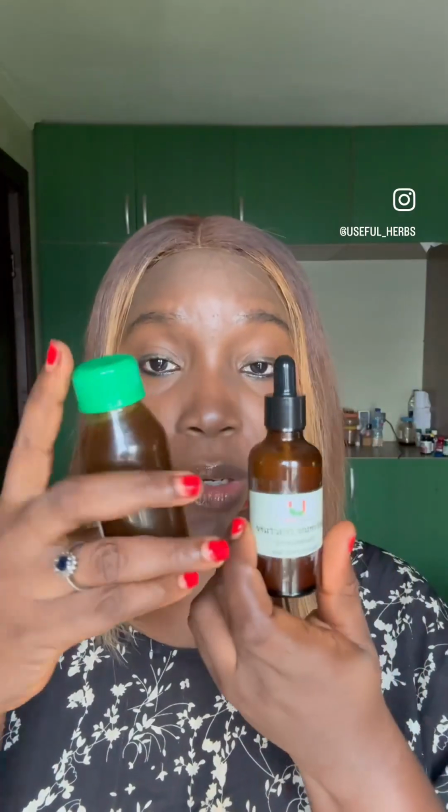Then the second product is our yohim tincture. Yohim is made from a plant that we popularly know as burantashi. The yohim contains yohimbine, and yohimbine is an alkaloid. So we have two products here that are supposed to contain alkaloids. You want to be sure that they both contain alkaloids, so you have to test them. When you are doing production, this is just a bottle. You could have like 10 liters of this.